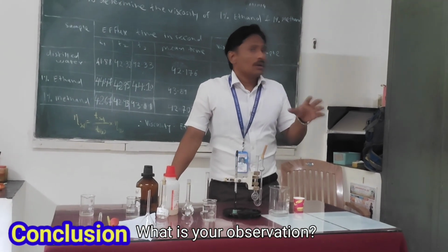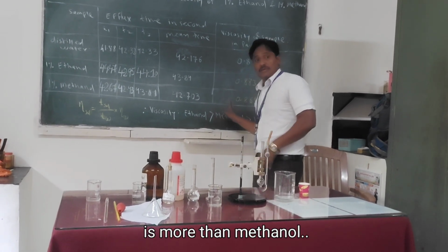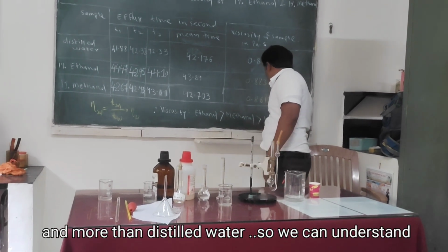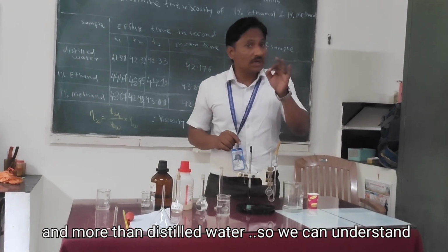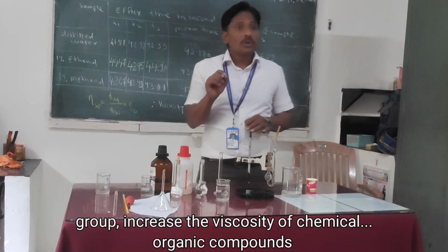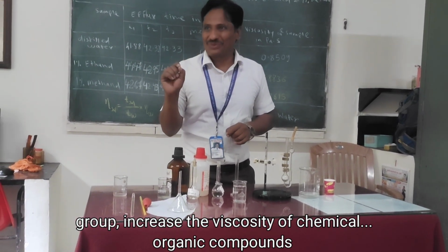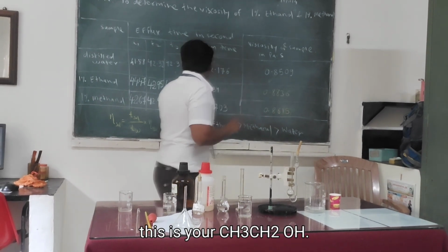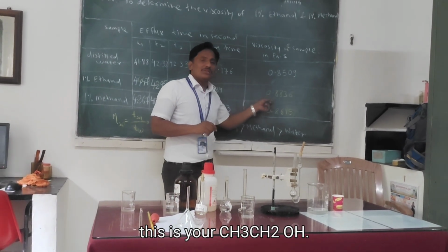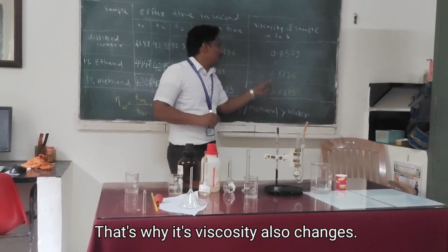So what is our observation? Our observation is that the viscosity of ethanol is more than methanol and more than water. So we can understand that one CH2 group increases the viscosity of an organic compound. One CH2 group, one hydrocarbon group. This is CH3CH2OH, only one CH2 is different, and that's why its viscosity changes.